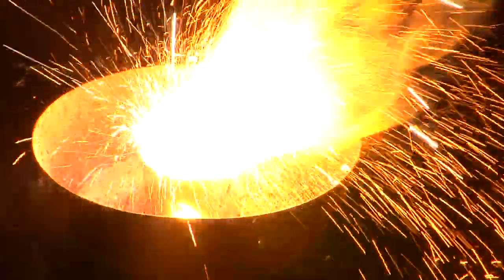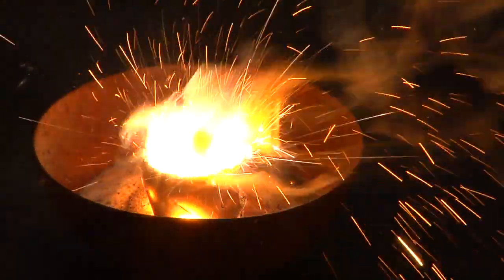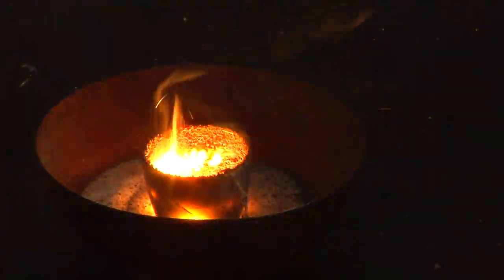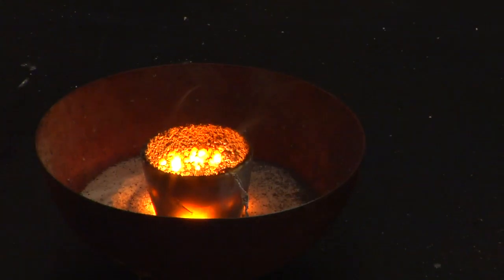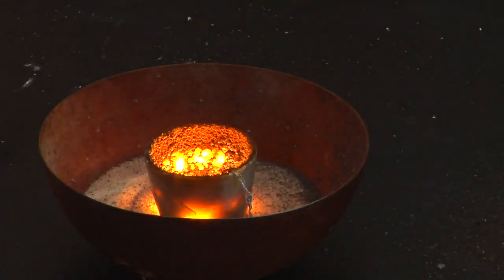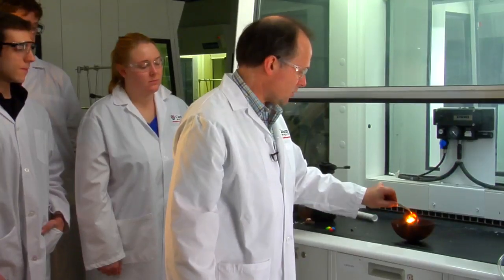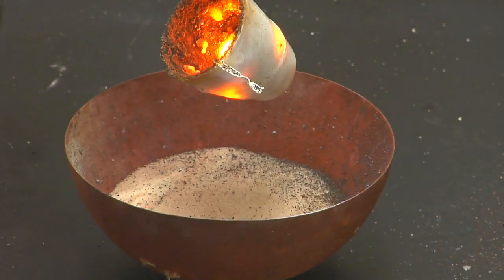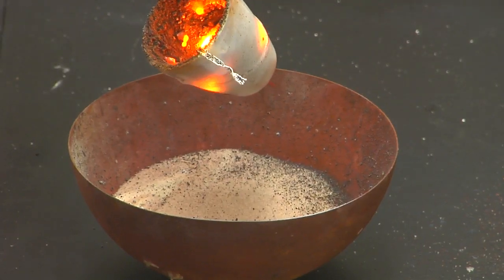So that's the oxidation of the aluminum and the reduction of iron oxide to iron metal. This reaction gets so hot they actually used to use it to weld railway rails together. If I tip this up, you can see that there's molten iron in the bottom of this — it's a combination of molten iron and aluminum oxide.